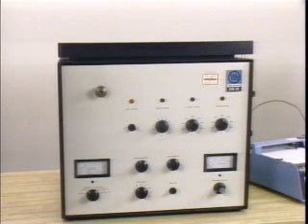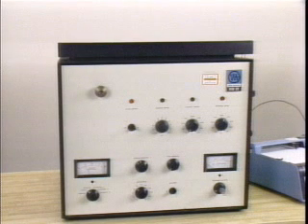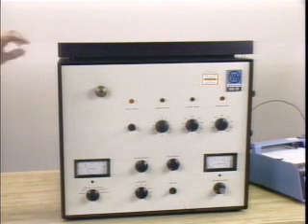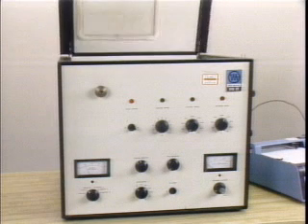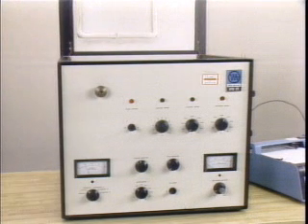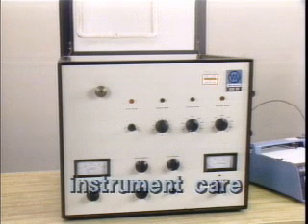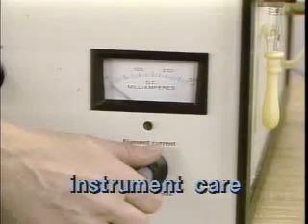However, because the time required for the detector and injection port to reach an equilibrium is long, these controls are not turned off until all work is completed for the day. If possible, the oven is open to allow the column to cool more rapidly. Before the carrier gas flow is turned off, the instrument should be allowed to cool down. After the system is cooled, check that the filament current of the detector has been turned off.